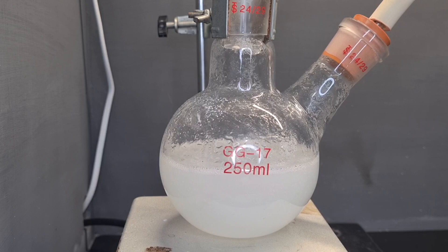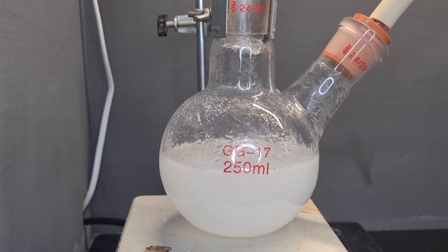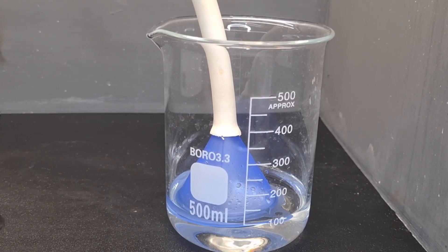Now that the reaction is producing ammonia gas, it's going to start pushing out all the air. And you can see this here.